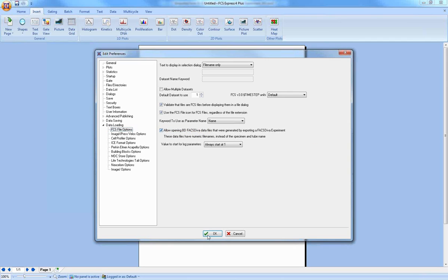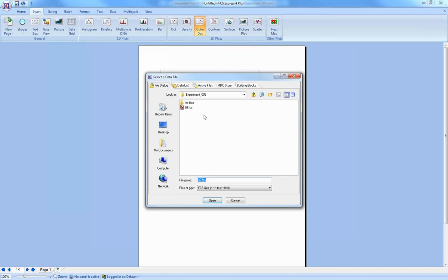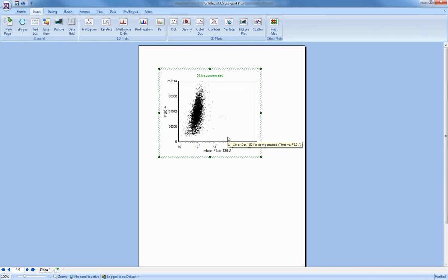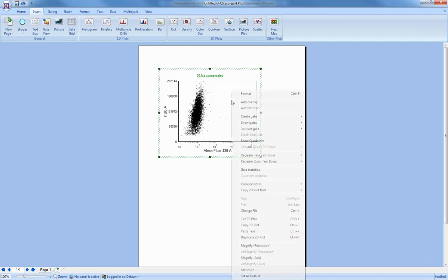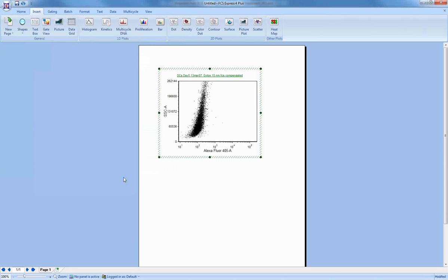And if I turn this on and press OK, now the next time I try to open the plot, it's going to find it. Okay, now as you notice, the time parameter comes first. That is a dead giveaway that this file was exported as an experiment. Okay, but all of the other parameters are here with all of their names, and you can still use this. And of course, you can also use a data file that's one of the standard data files, and you can open that without any problem.